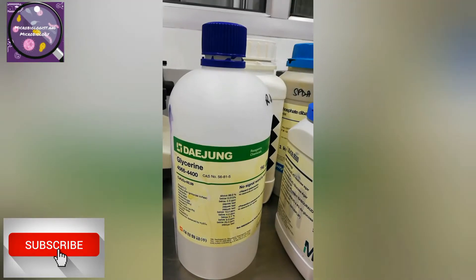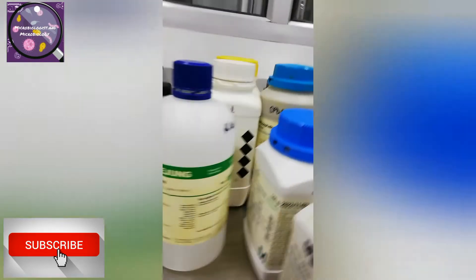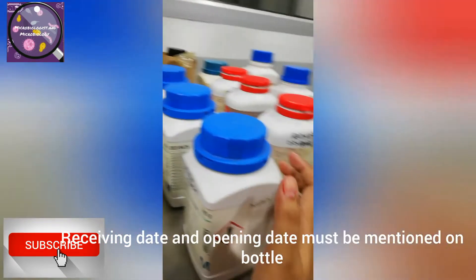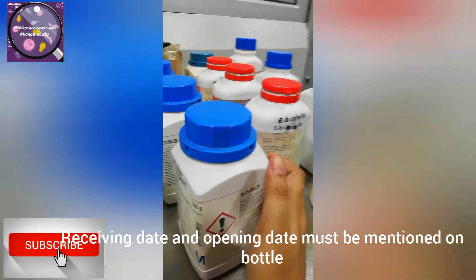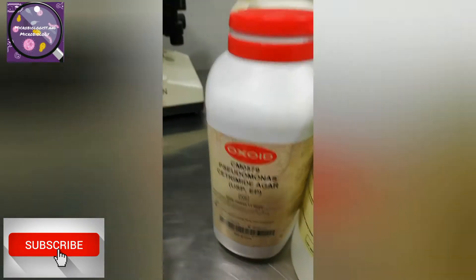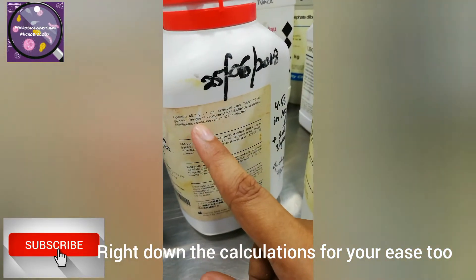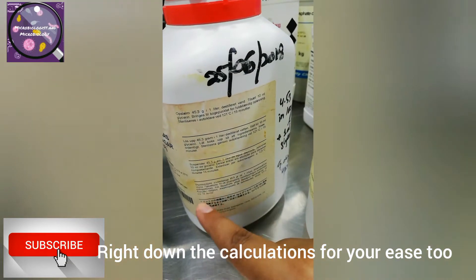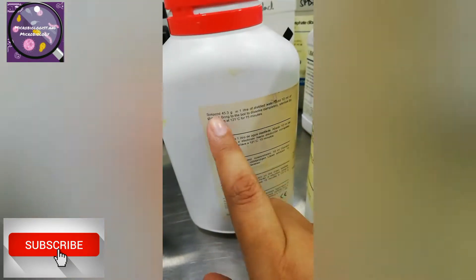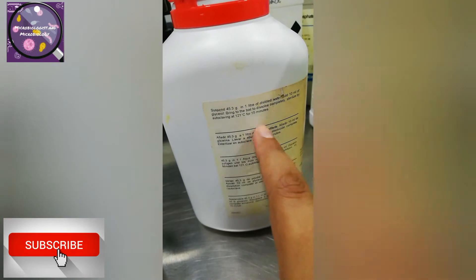We are using these media and as a microbiologist you have to know why we are using them. I have written down the receiving date, opening date, and the calculations as well on each bottle.